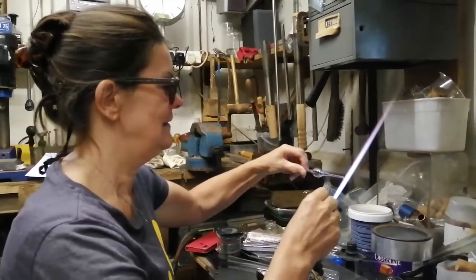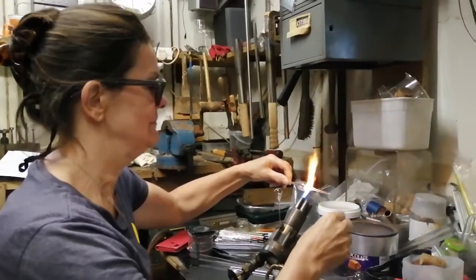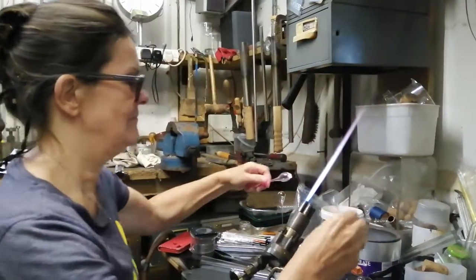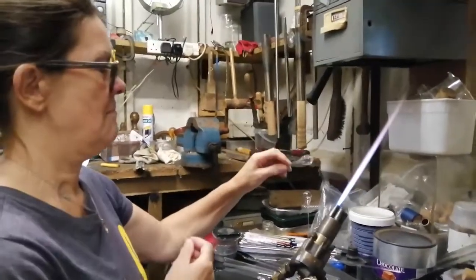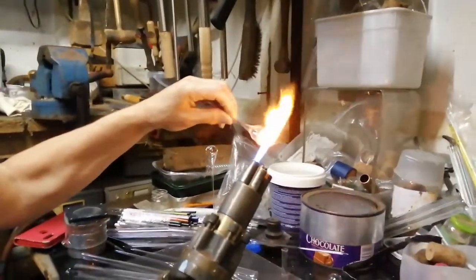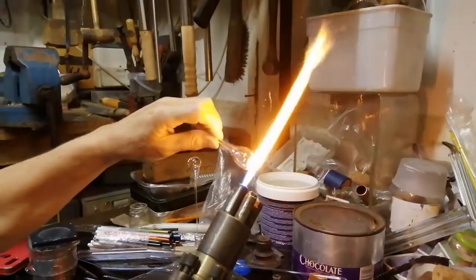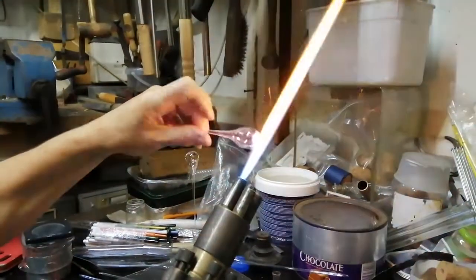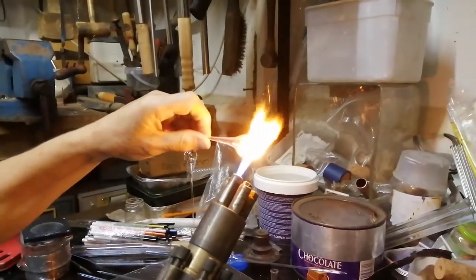Okay. So that's it. Glass in, get the flame close into the corner by the big diameter. Keep turning, make sure you keep turning the left-hand side. That's it, dump that there, Carolyn, well done. And then back into the flame. Glass at an angle. Let's come in close so we can see what's going on. Have the glass coming through the flame slightly. That's it, nice pinch and turn. That's good. That's good. Excellent.